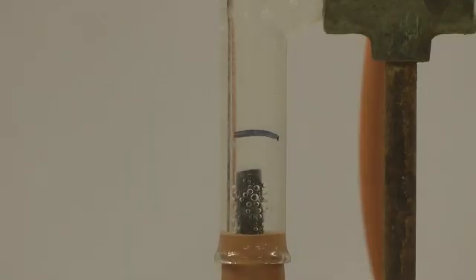When we turn the power on you can see bubbles of hydrogen gas forming at the negative electrode which in this case is made from carbon. The positive electrode however cannot be made from carbon because oxygen gas forms here. Instead we use platinum because this doesn't react with oxygen as carbon does.